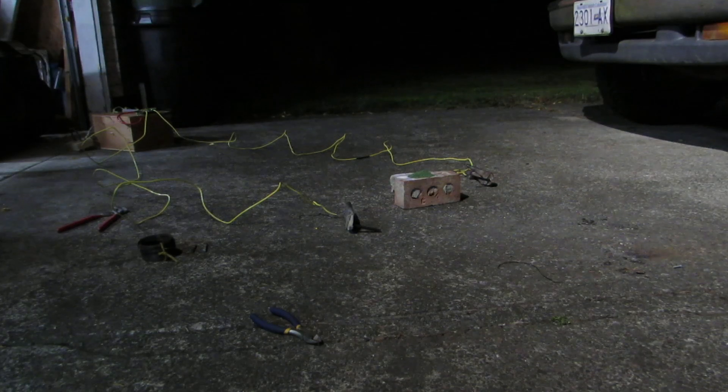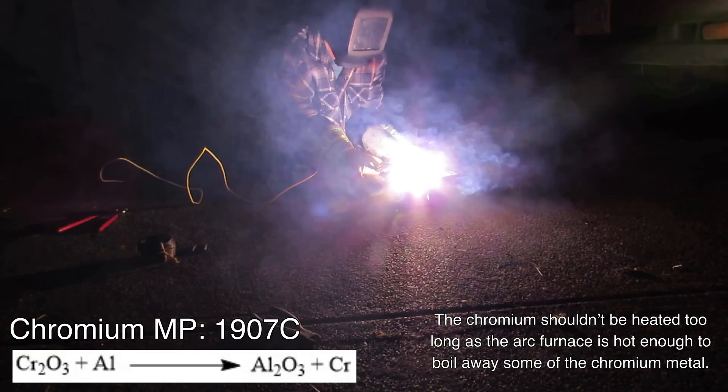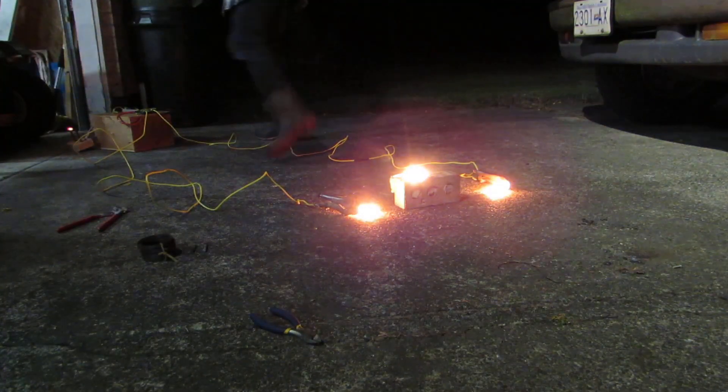so we will use my electrical arc furnace to fully react everything. The mixture was heated to around 3000 degrees celsius for a minute or so and then it was allowed to cool.